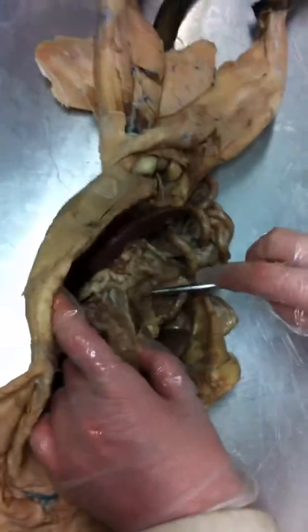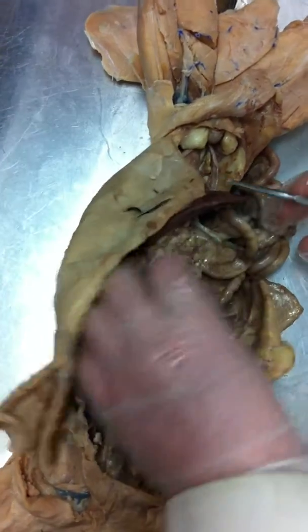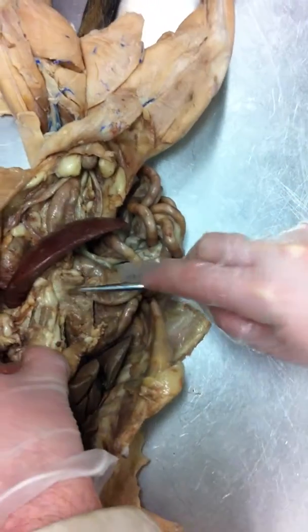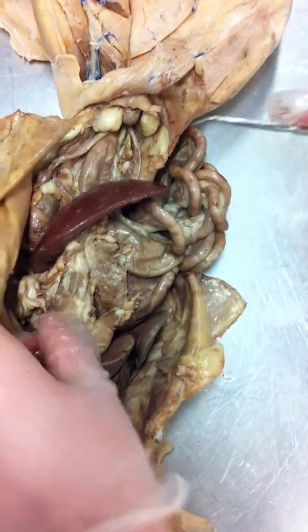And then under the stomach, you can see this glandular material. This is the pancreas. So this material here is the pancreas under the stomach. Is it all fat over there? Yeah, this is fat, the yellowish, but this material here is pancreas. It looks lobular, like cottage cheesy.